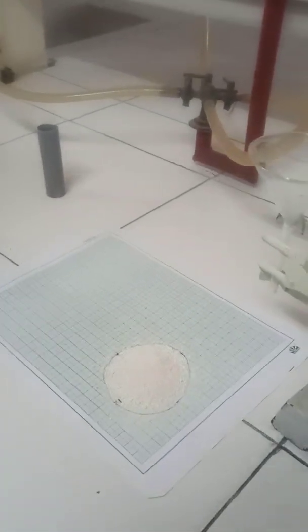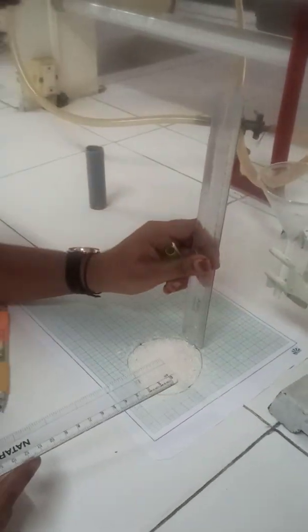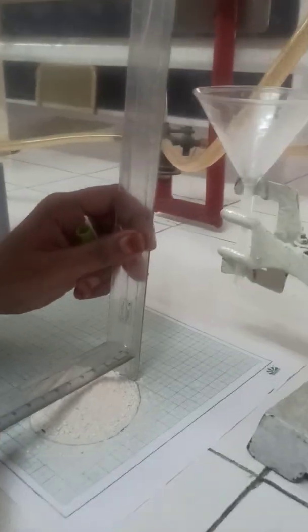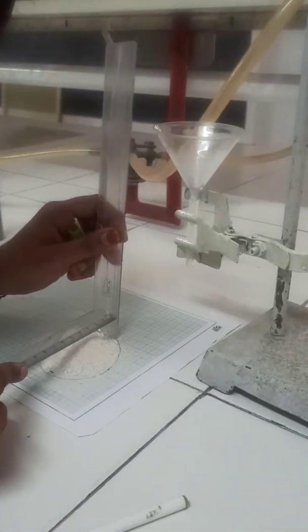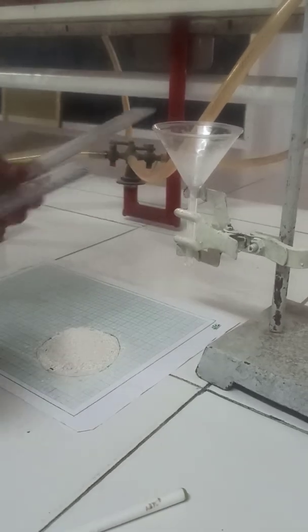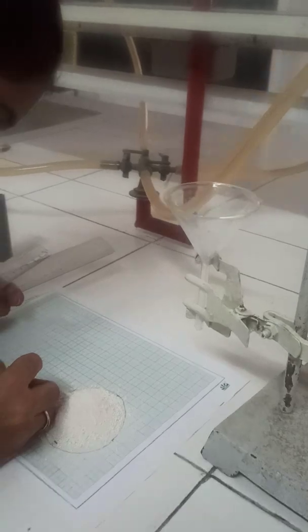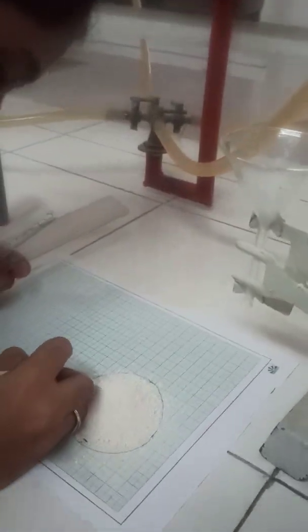Now measure the height of the pile with the help of two scales. One is placed vertically and another is placed horizontally on the pile. Note down the height of the pile in centimetres.